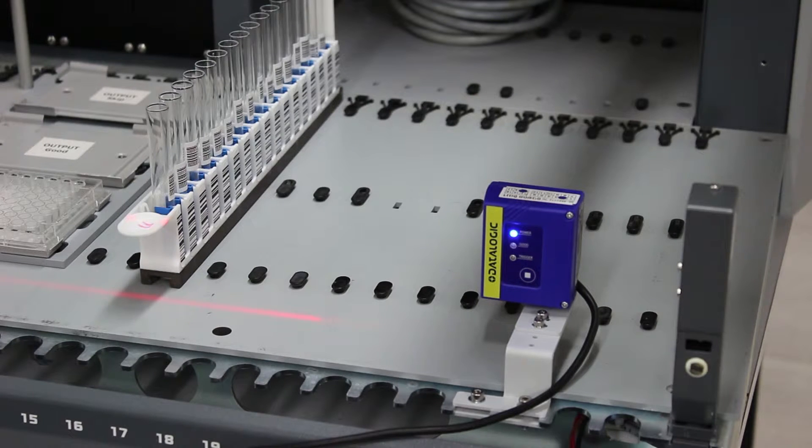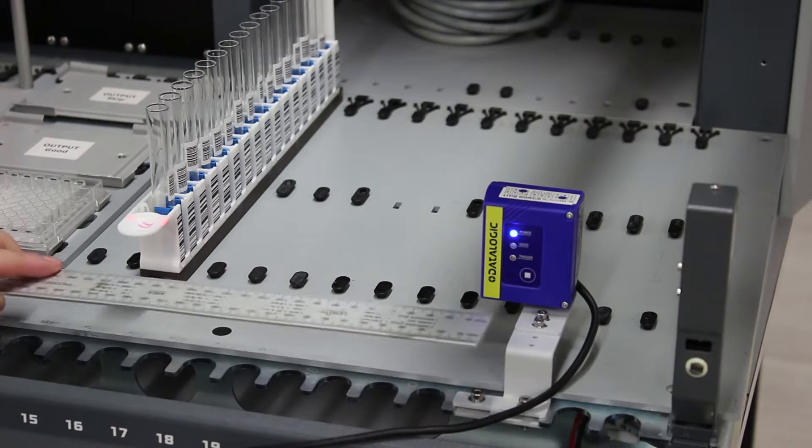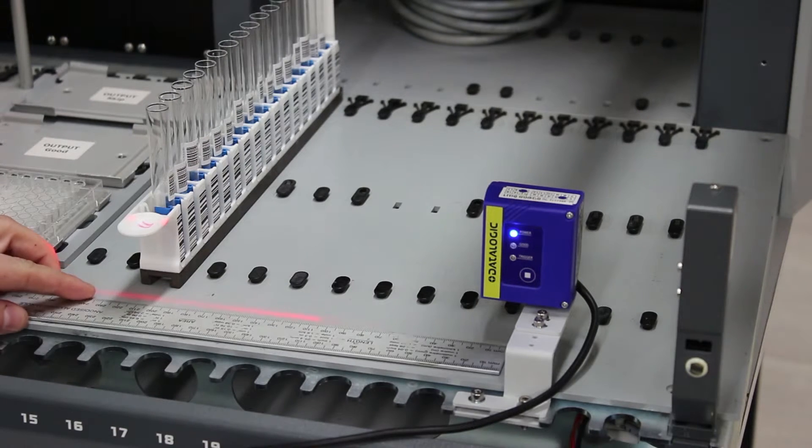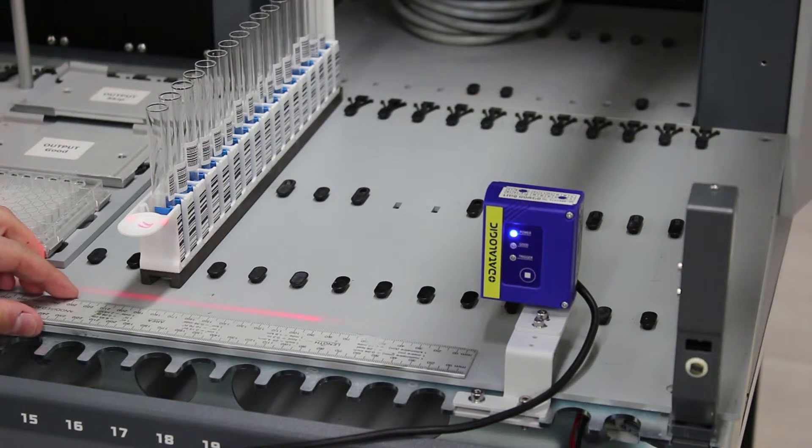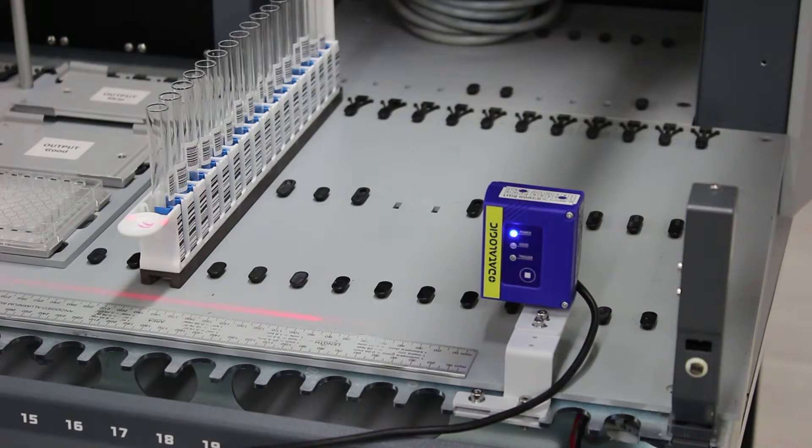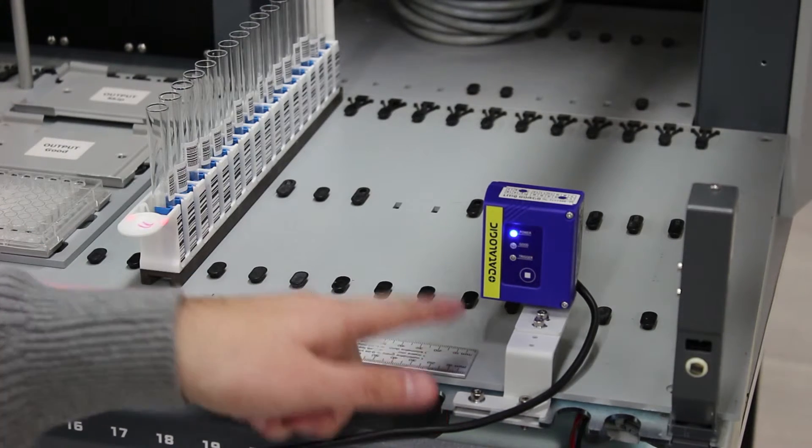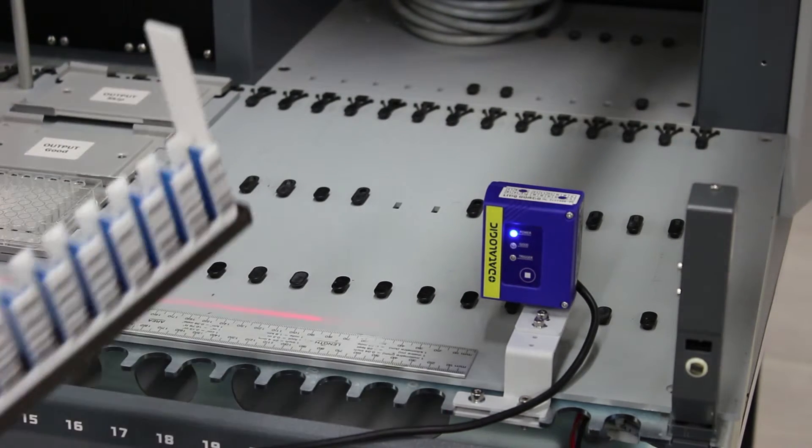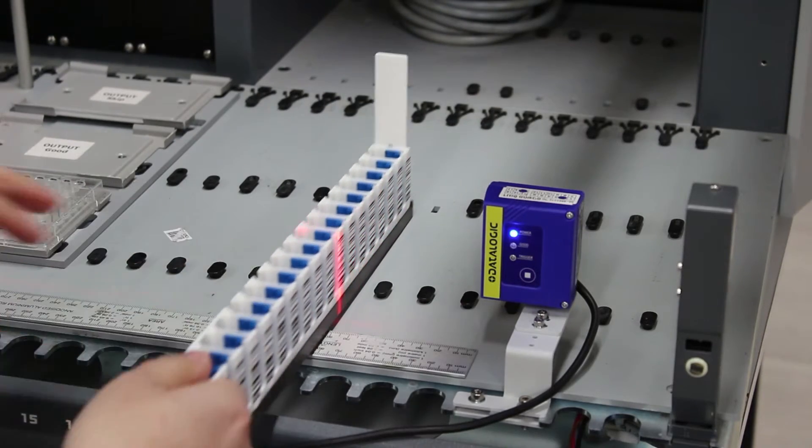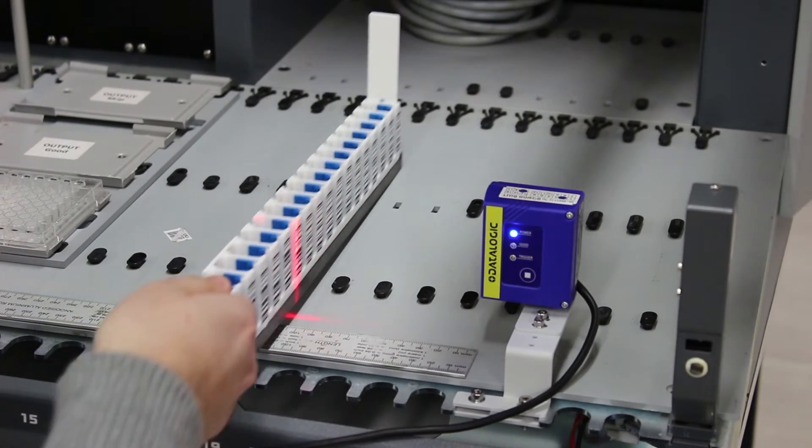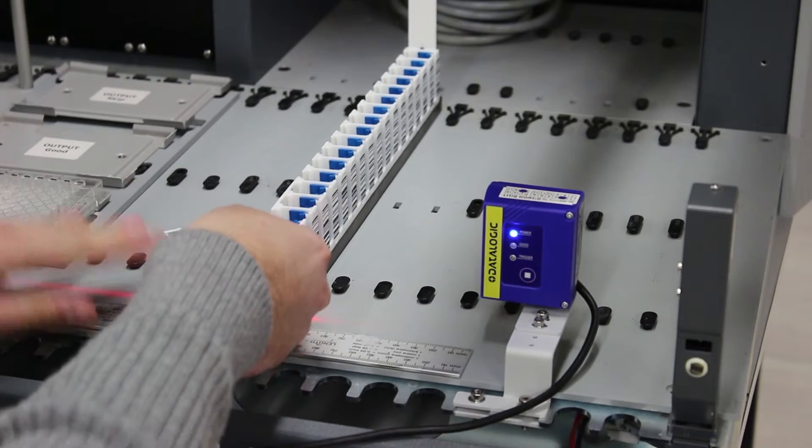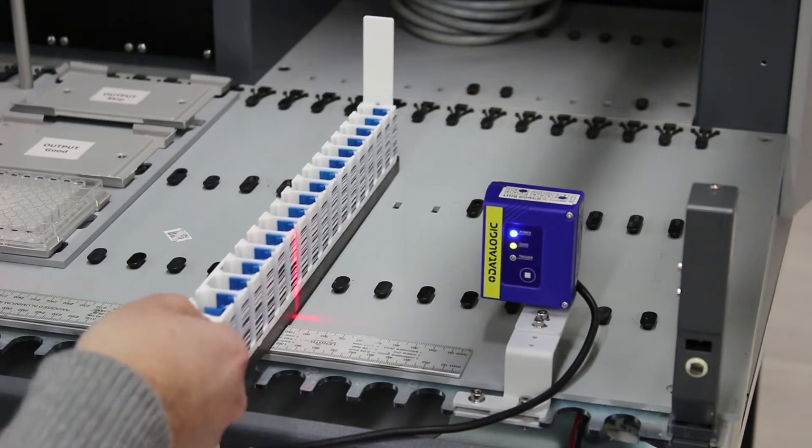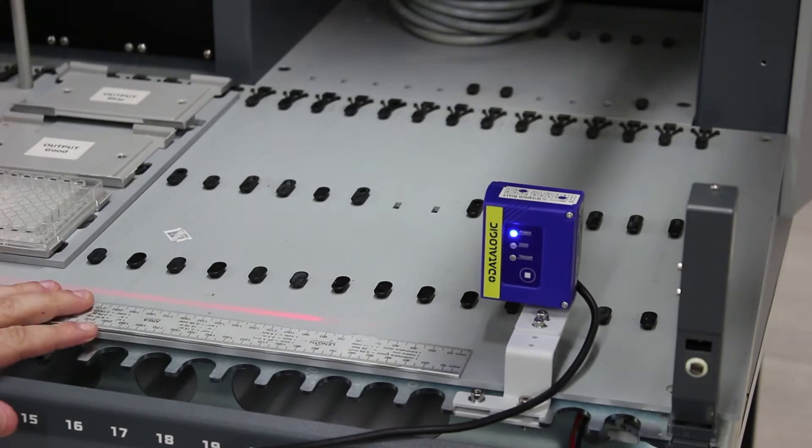To determine how many tube racks can be used with TubeID at the same time, we need to measure the range at which tubes can be read by the barcode reader. To determine this range, we'll use a ruler starting from the front of the barcode reader. The included barcode stickers are large and can be read at any point between 10 and 45 cm away.